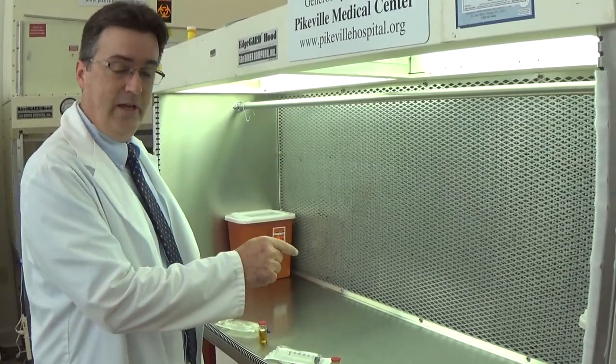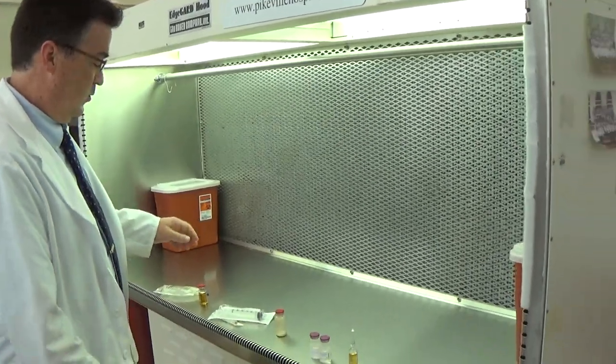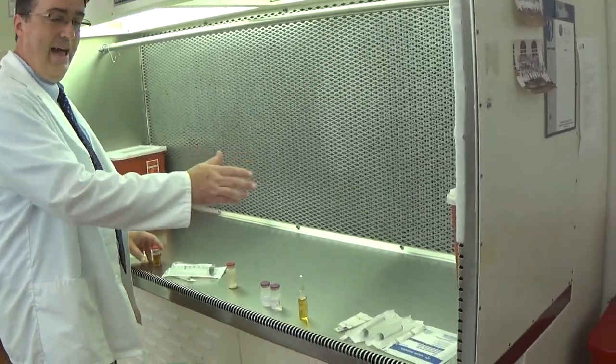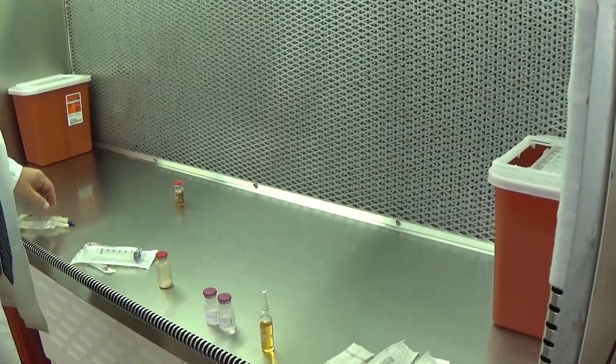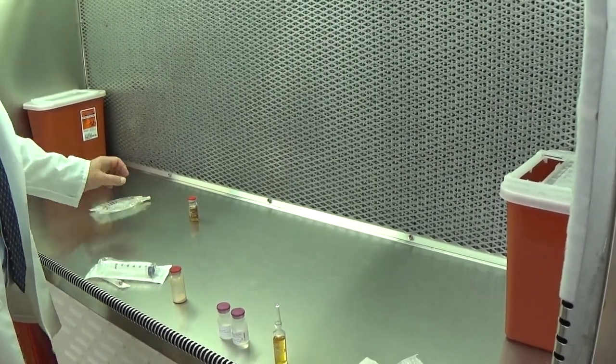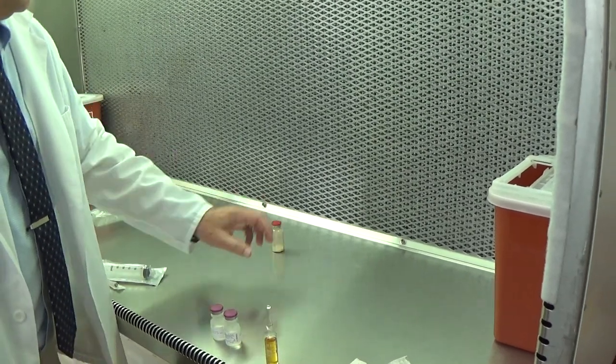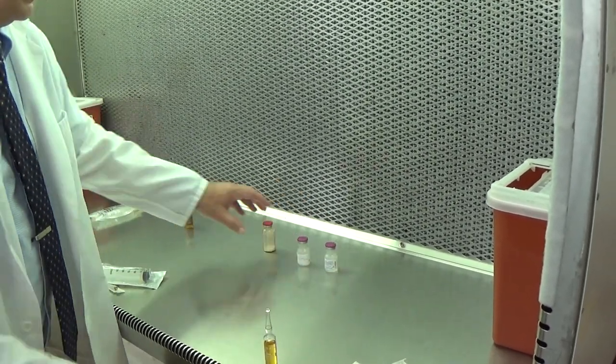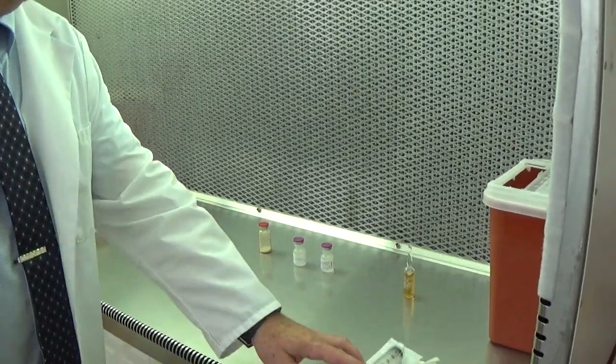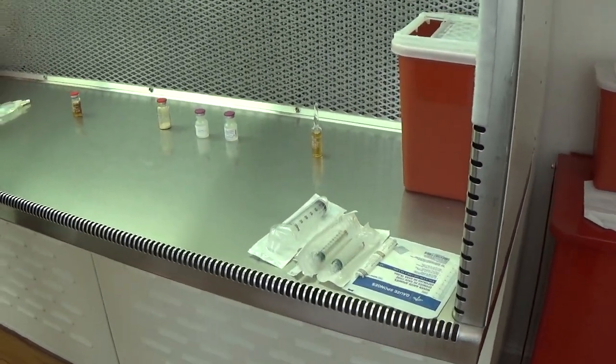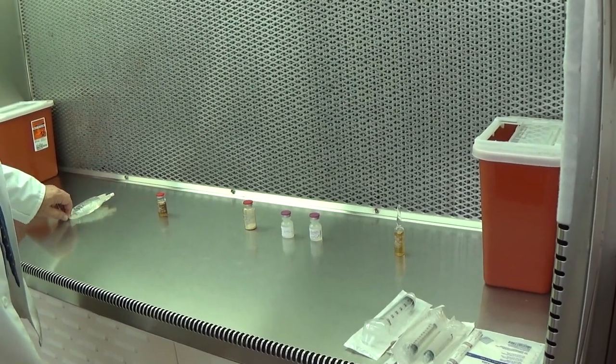But first I want to discuss placement in the hood. When you gather your supplies, after you've cleaned everything, you want to move all your materials into a location that places them in first air. These needles and syringes aren't open, so they're not critical to the project just yet.